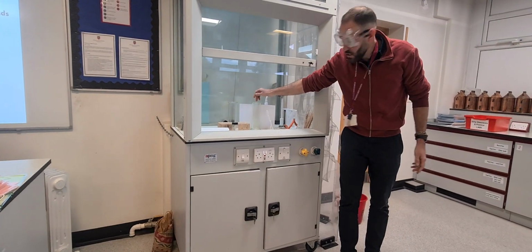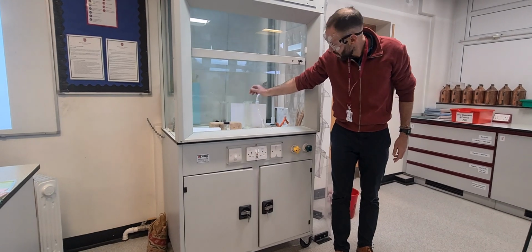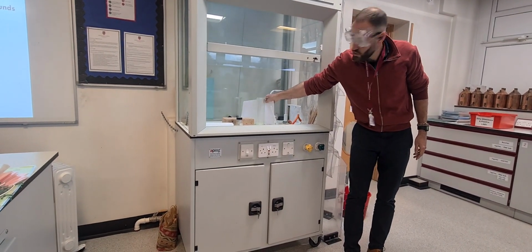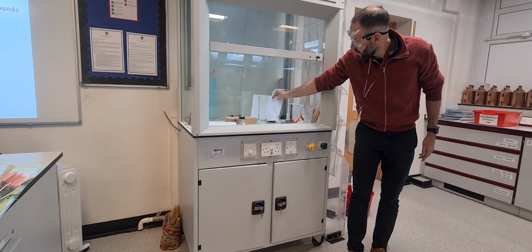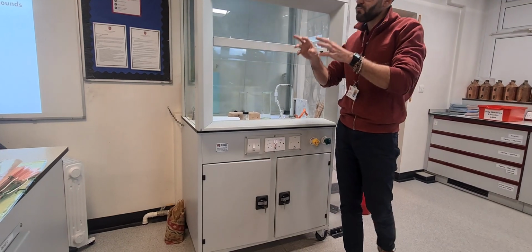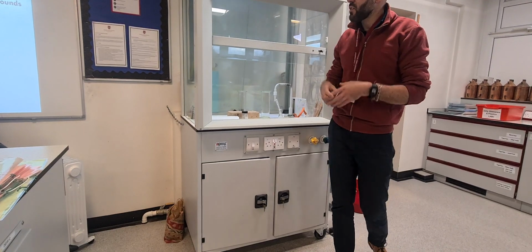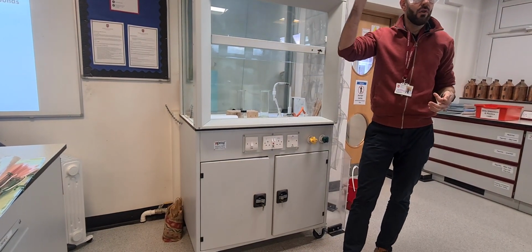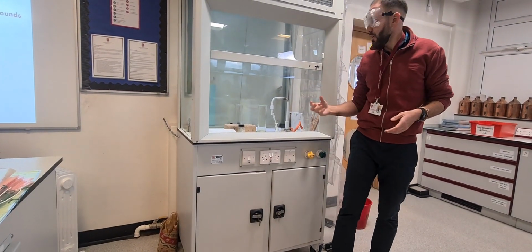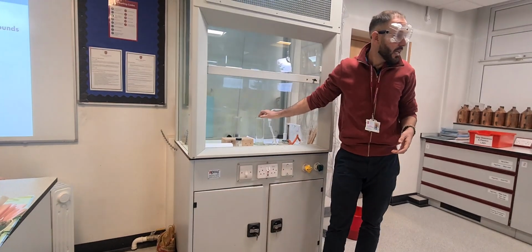Right, in this vial here, are we filming? Great. In this vial here we have chlorine gas. Hopefully you can see that it's slightly yellow. The halogens can become gas very quickly. Fluorine is above chlorine in the group. It's very, very reactive, so we can't get it. Chlorine we can. Does anyone know about chlorine gas?